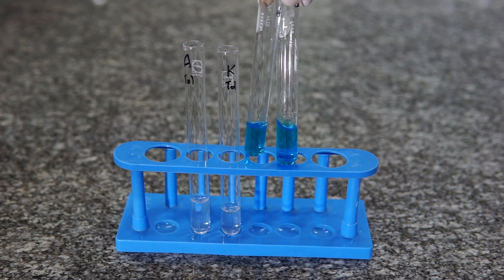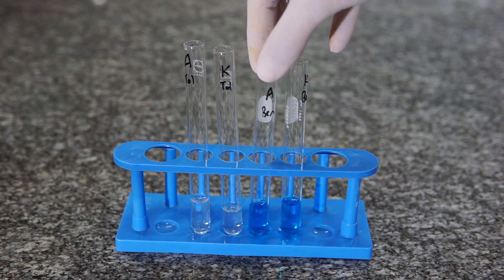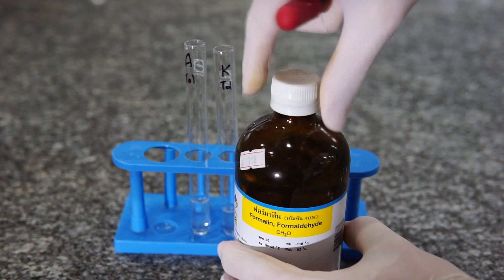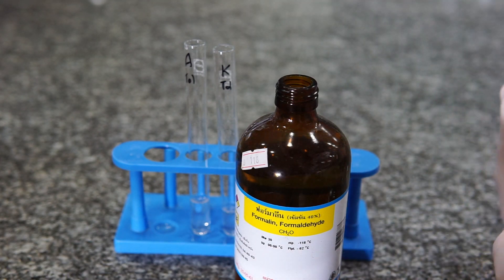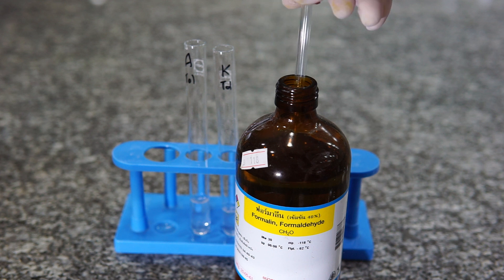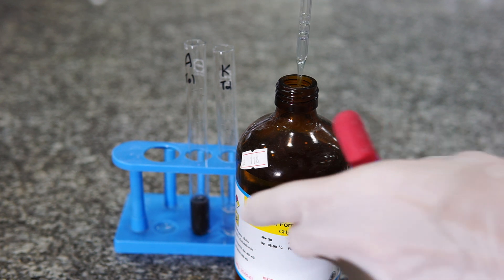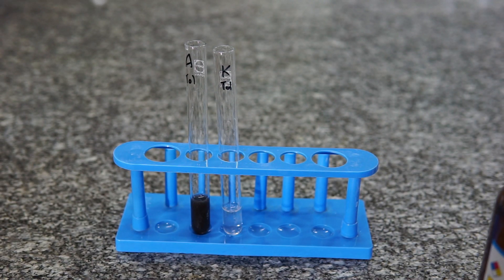Just as a comparison, I've also got the Benedict's which I prepared earlier. First of all we add some aldehyde. You can see that the aldehyde has reacted as soon as it's been added to the Tollens reagent. You can see that lovely gray-black precipitate which is forming straight away.